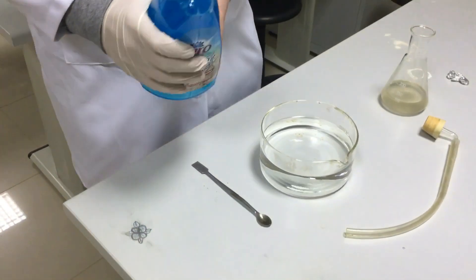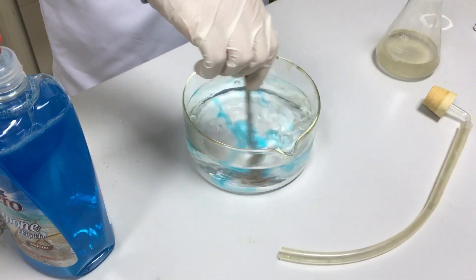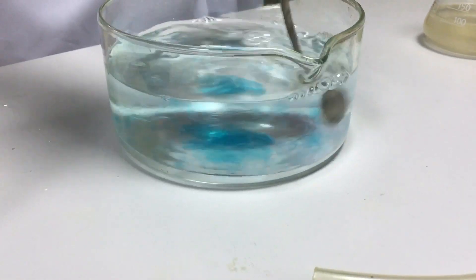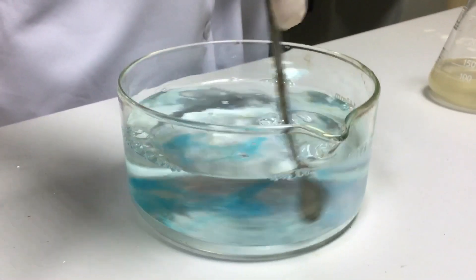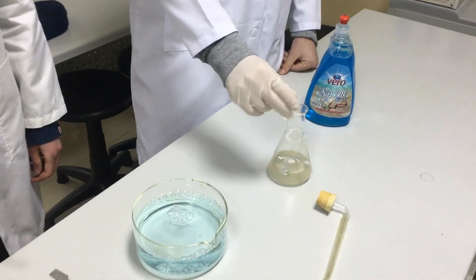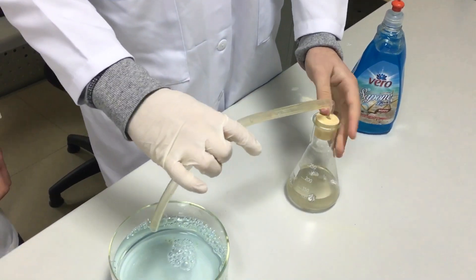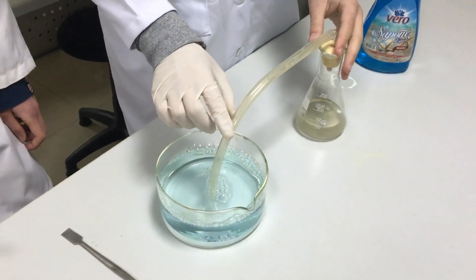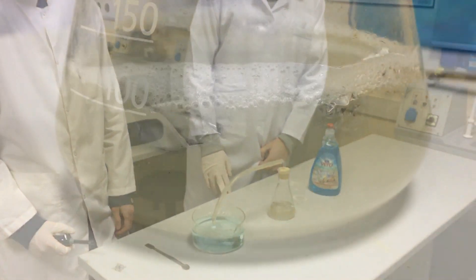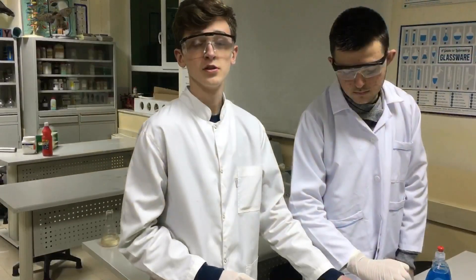First we put some liquid soap into the water. We are going to put aluminium in hydrochloric acid. The reaction is slow because, as we said, aluminium protects itself by its oxide. The hydrogen bursts in the presence of oxygen.